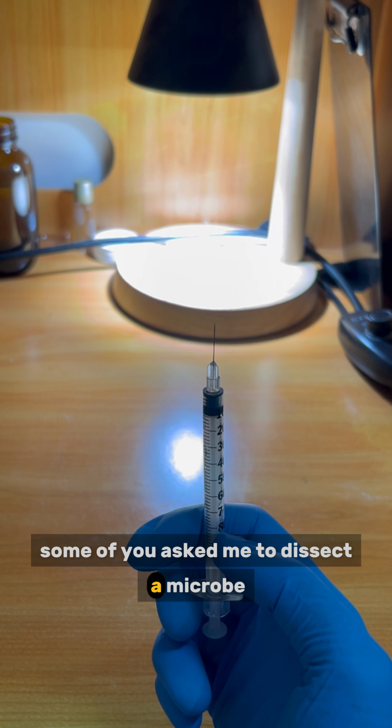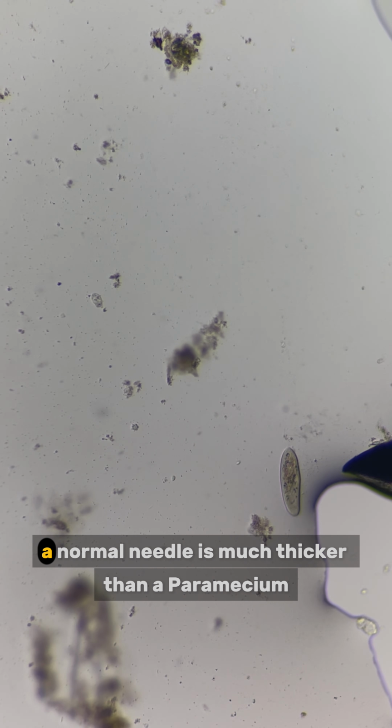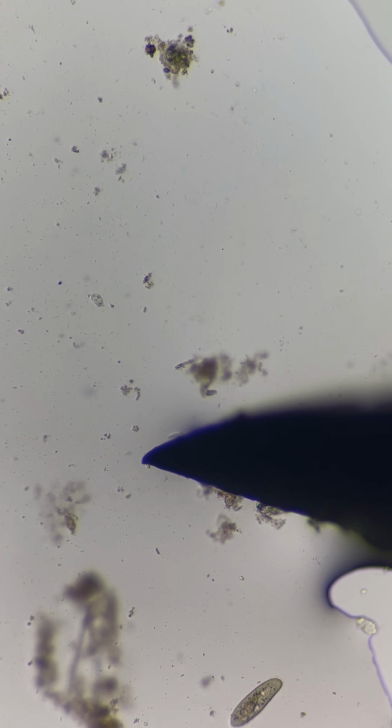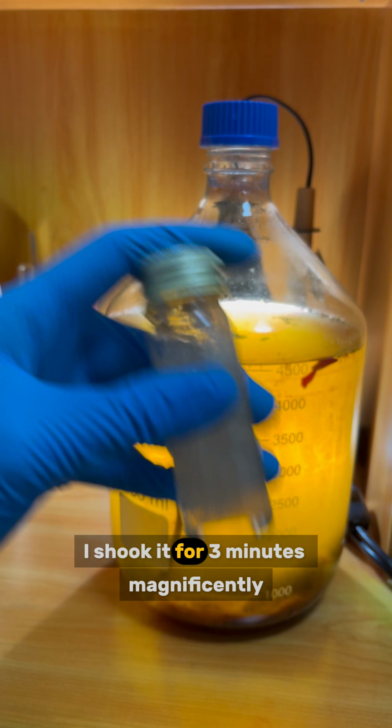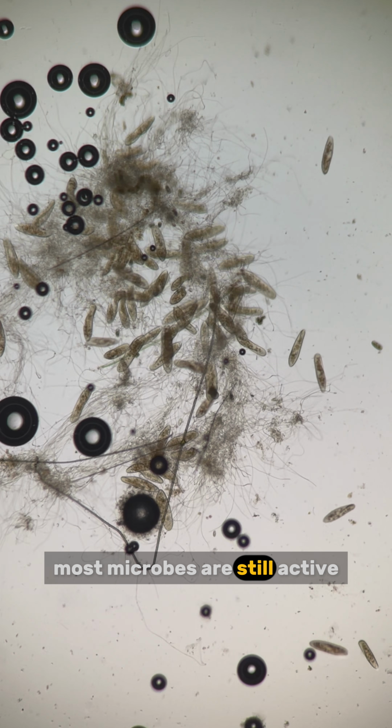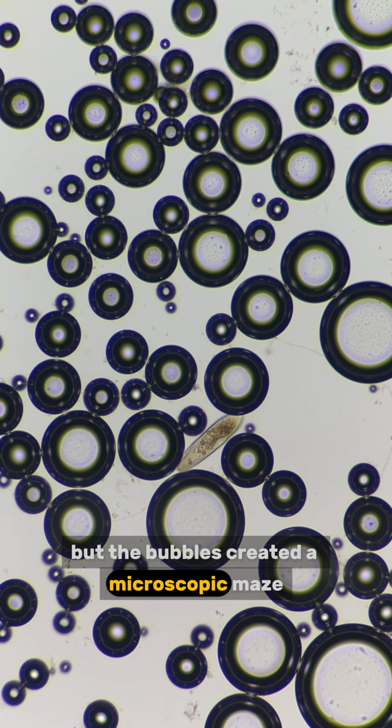Some of you asked me to dissect a microbe using a needle. Unfortunately, a normal needle is much thicker than a paramecium, so it's basically impossible. One of you also asked me to shake the jar. I shook it for 3 minutes. Magnificently, most microbes are still active. But the bubbles created a microscopic maze.